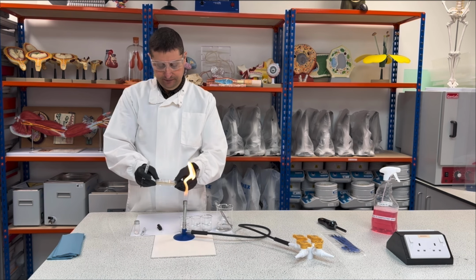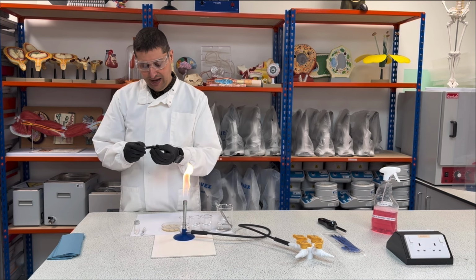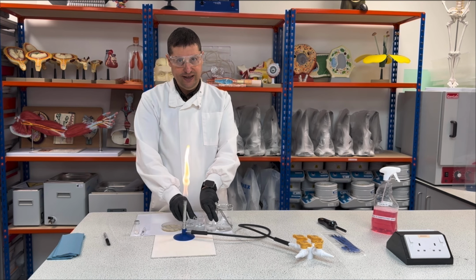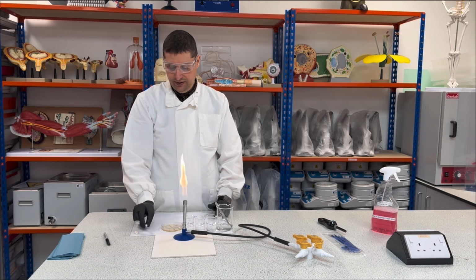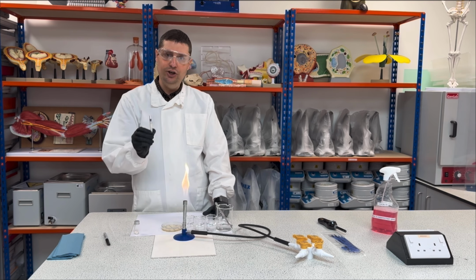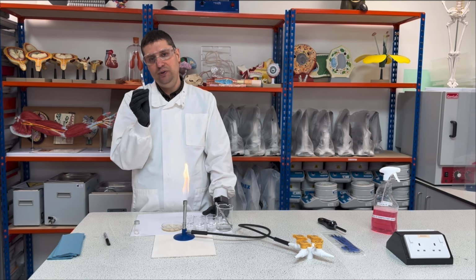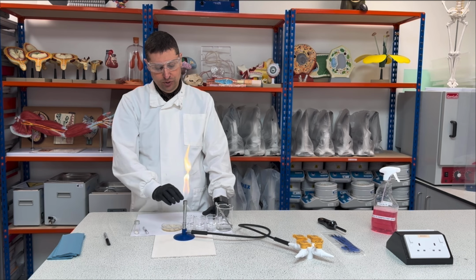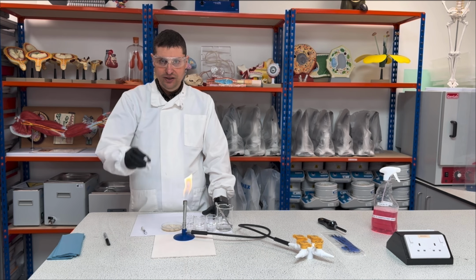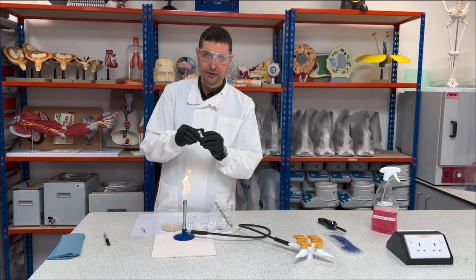So then I will turn and place here in front of me. So now I can close that and put aside. So I have my 3 samples and my control, my penicillin. Because the penicillin I know that works, this should be the last one to be used. So the first thing I will do is use my substances, okay? So here I have my sterile paper discs.